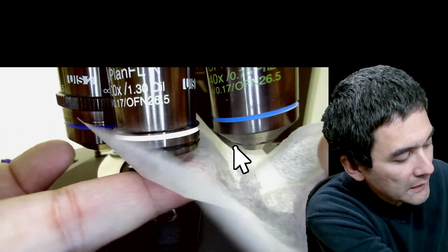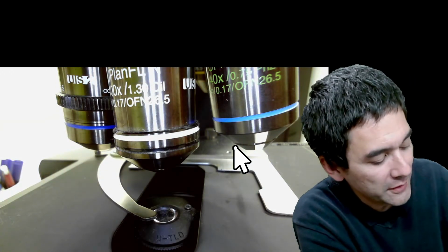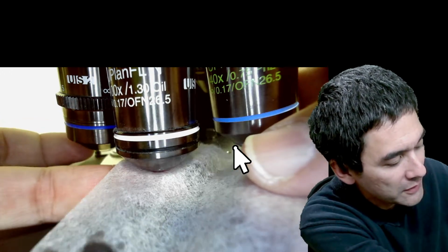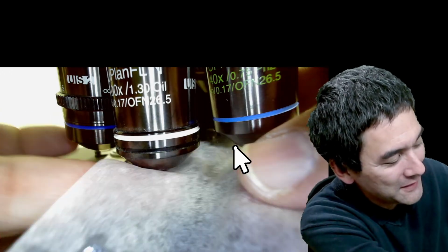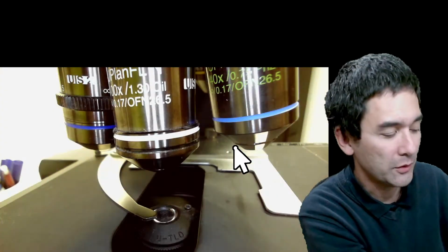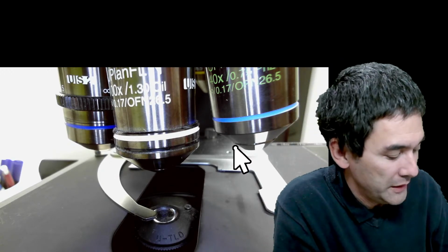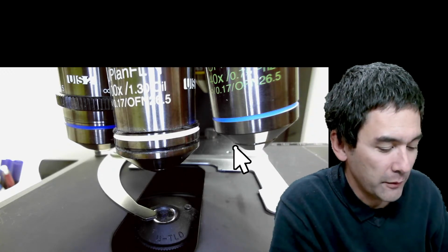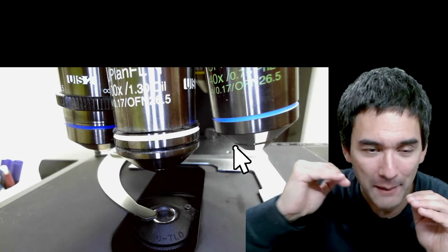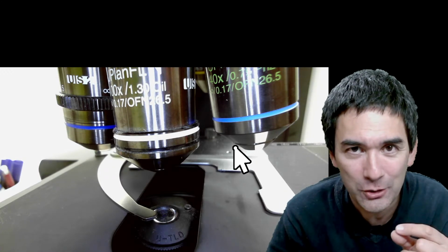The thing is the following, the front lens is concave. I just want to tell you another story from my sales representative, who is also a bit of support and technical advice. See, now there's nothing on it. That's the oil, and then I throw the paper away. What the sales rep said is the following: I was kind of worried that, at least with the objectives that I have here, the front lens is not completely flat, but actually concave. It goes inwards. So basically what happens is if you do crash the objective into the slide, it's not very likely to damage the front lens.